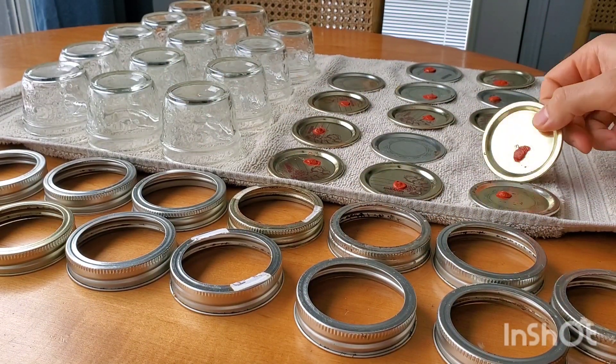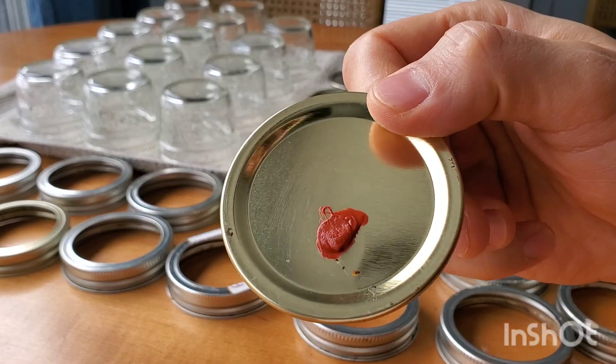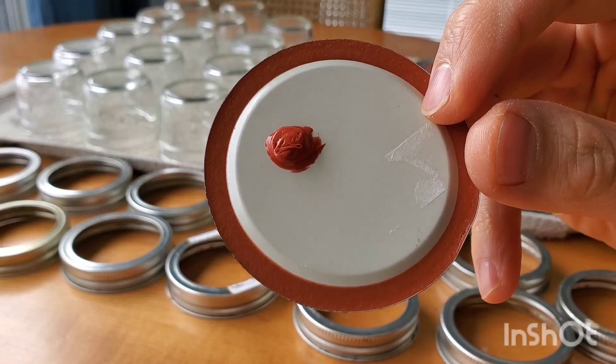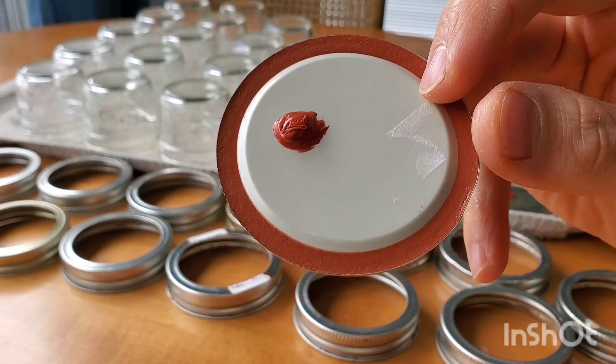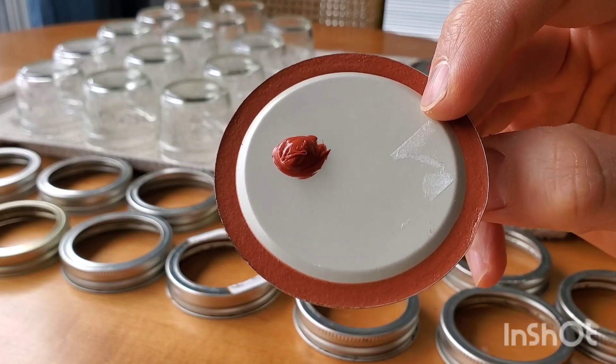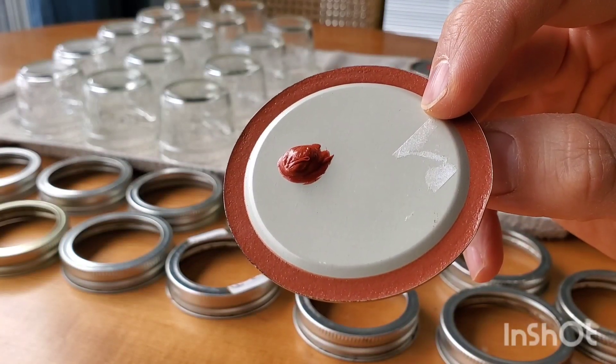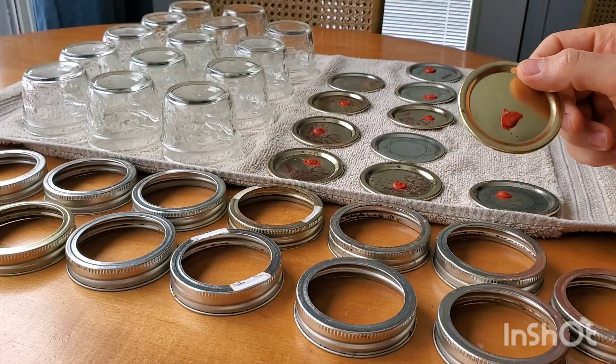The lids here — I've drilled an injection port in there and put high-temp silicone on top so I can test all my liquid cultures using these agar jars. I think testing is very important and should not be overlooked. I have not included an airlock lid in these because it is not necessary for agar — it does not need to breathe like liquid culture and grain.